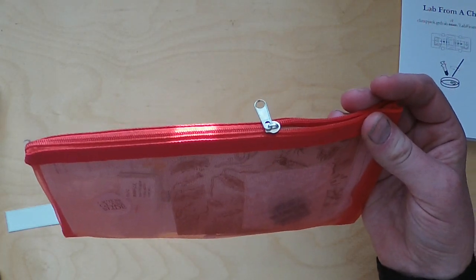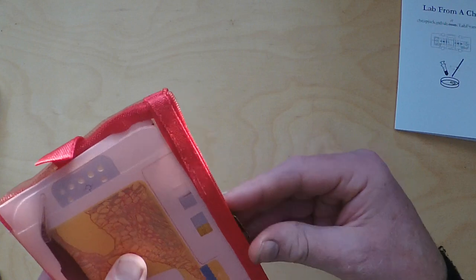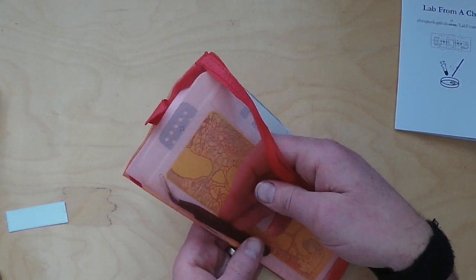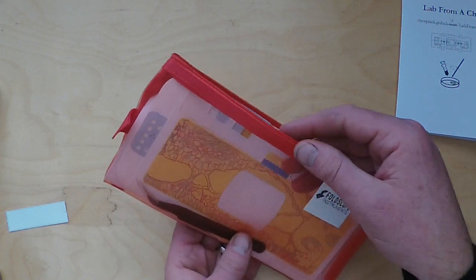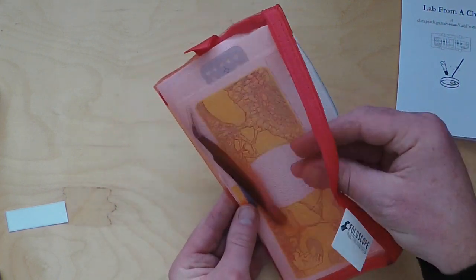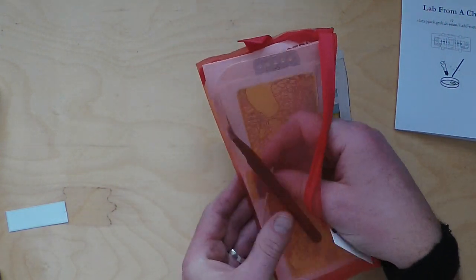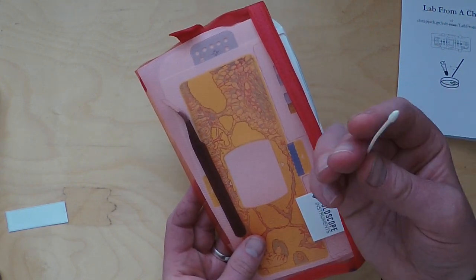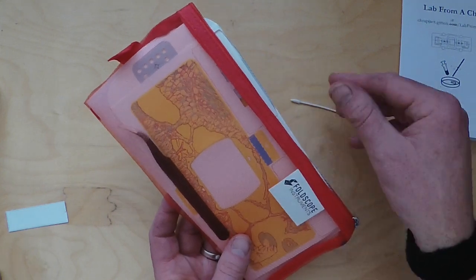Okay so you'll get your Foldscope little bag, unzip it. There's a pair of tweezers that will be handy for our slide preparation later. There's also a tiny little q-tip, this is for cleaning the lens which I'll explain later. Put that to one side.